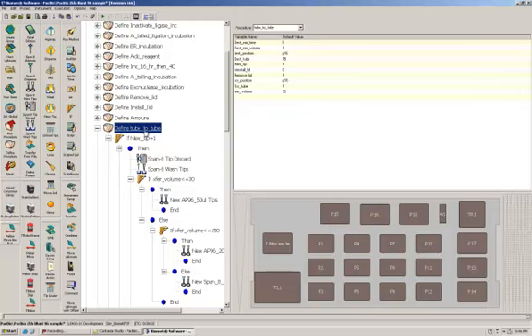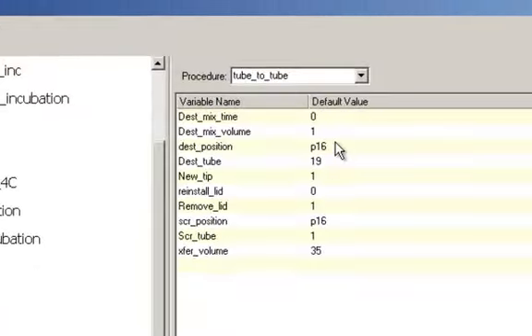Okay, let's look at one more procedure, the define tube to tube. This procedure is only used for making the master mix. It basically transfers from one tube to one tube at a certain deck position, and you can specify that in all the variables that you pass the procedure. We have the destination mix times, how many times you're going to mix after you do the transfer to the new tube or the new location, and the mix volume. The destination position is what position on the deck the piece of labware or tube rack is.